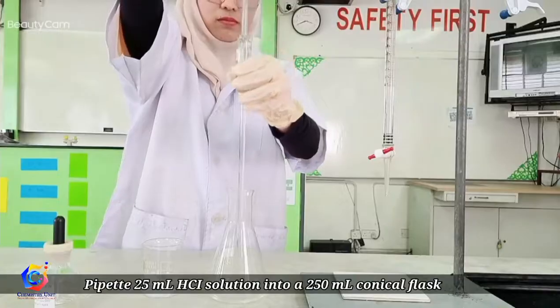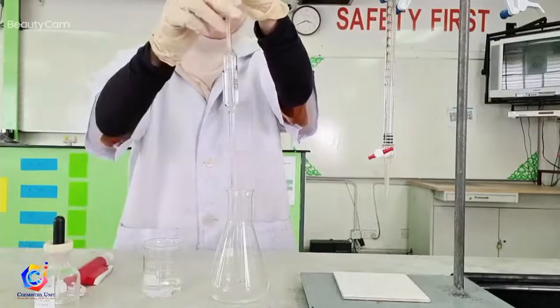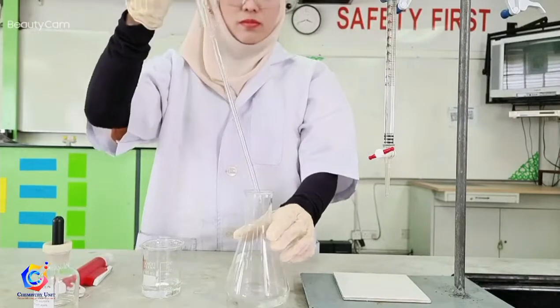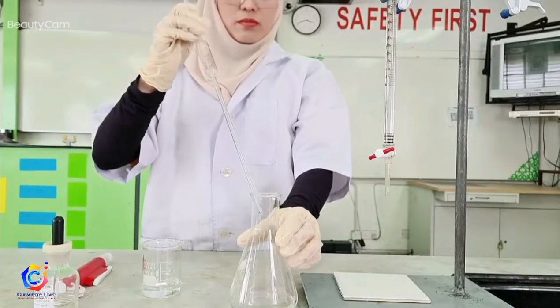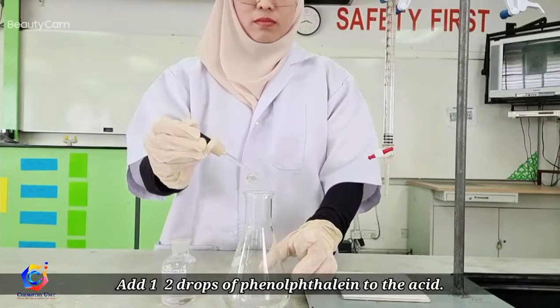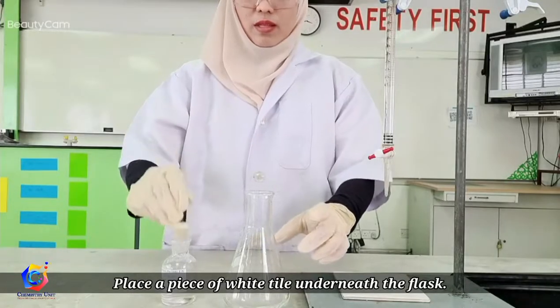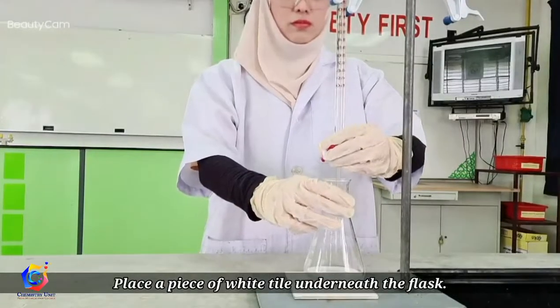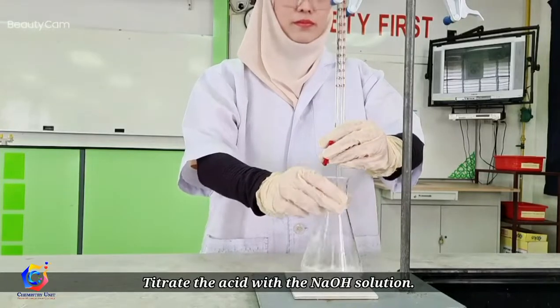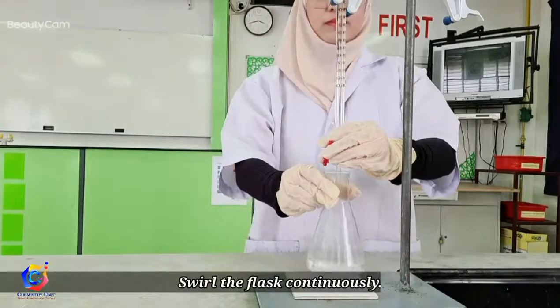Transfer the solution. At this point, remember the last drop must remain at the tip of the pipette. Add one or two drops of the indicator to the acid. Place a piece of white tile underneath the flask. Titrate the acid with the NaOH solution and swirl the flask continuously.